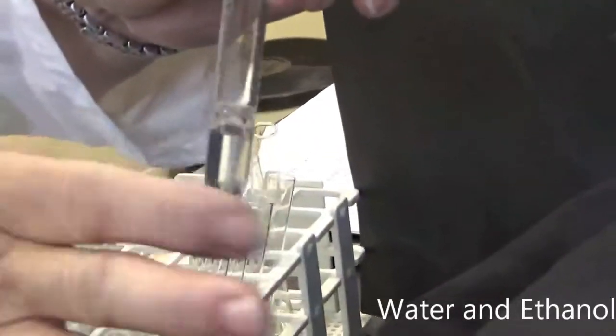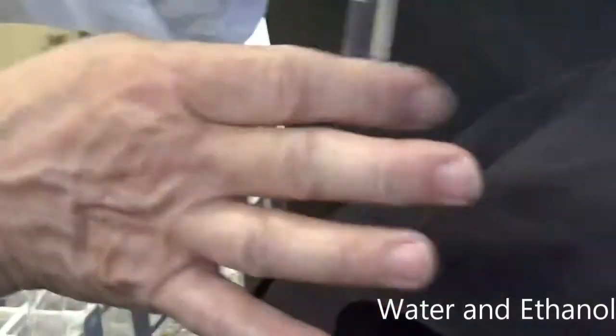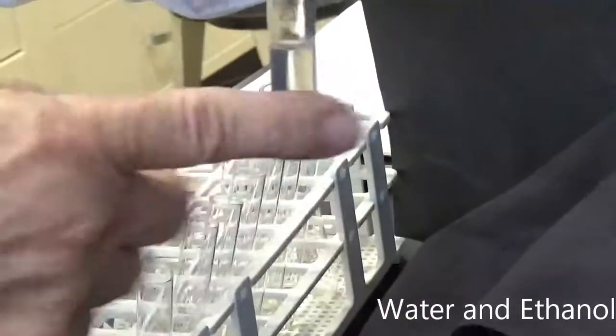Now, our next one is going to be water mixed with ethanol. And so probably about equal amounts. I'm going to mix it a little bit here, and we'll see what we get. What do you notice? And we're going to watch it for a little bit.